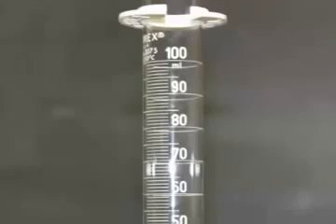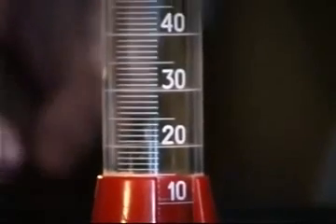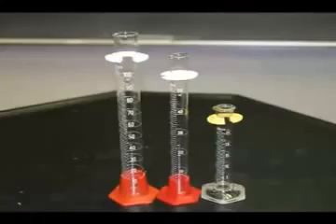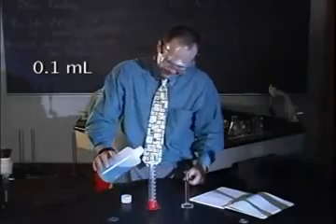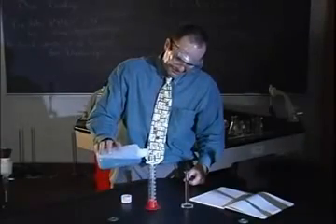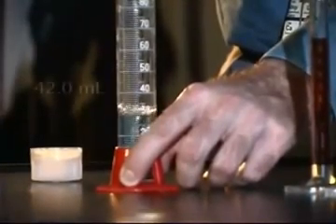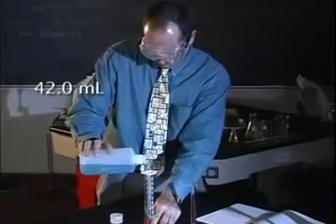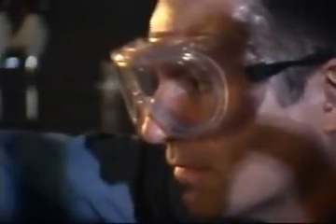You will typically use a graduated cylinder to measure liquids. 100, 50, and 25 milliliter graduated cylinders have major divisions for every 10 milliliters and subdivisions of 1 milliliter. Therefore, a tenth of a milliliter can be estimated and a volume is recorded to the tenth of a milliliter. Even if the volume is a whole number, the tenth place must be indicated. For example, data recorded as 42.0 milliliters would indicate that the bottom of the meniscus rested exactly on the 42 milliliter mark, not slightly above or below.